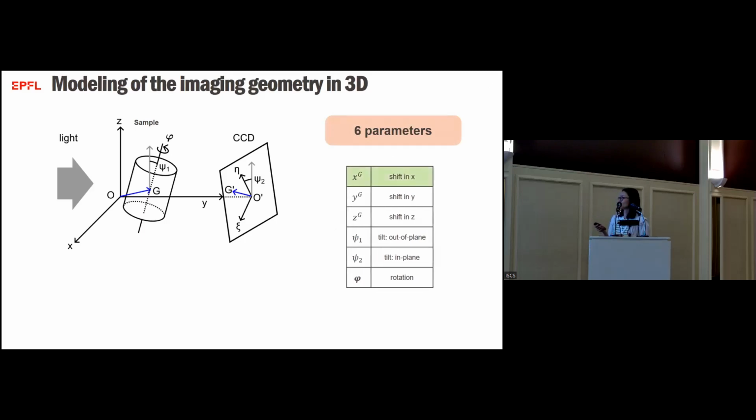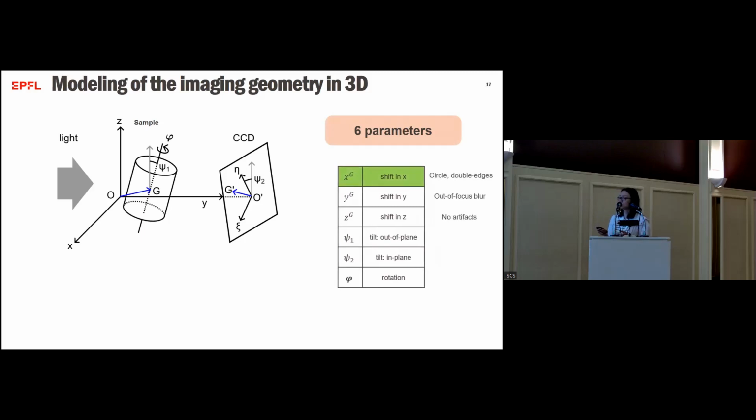We have seen that a shift in the x direction causes circles and double edges. And to quickly mention it, if you have a shift in the y-axis direction, you will have an out-of-focus blur. And if there's a shift in z, there are no artifacts.